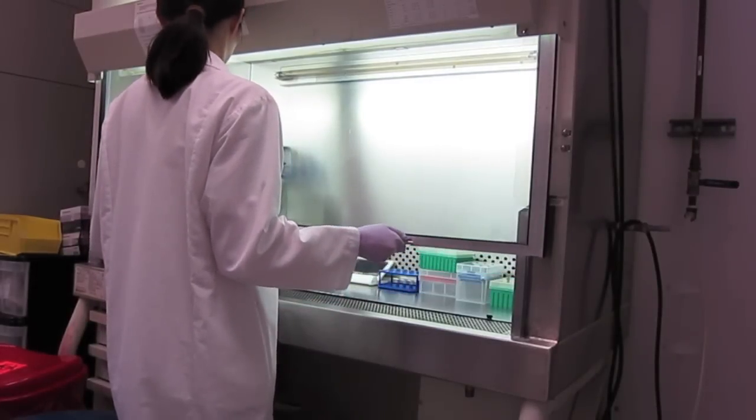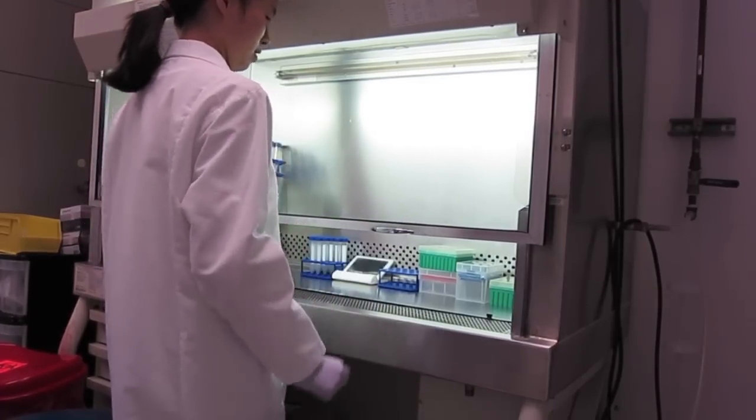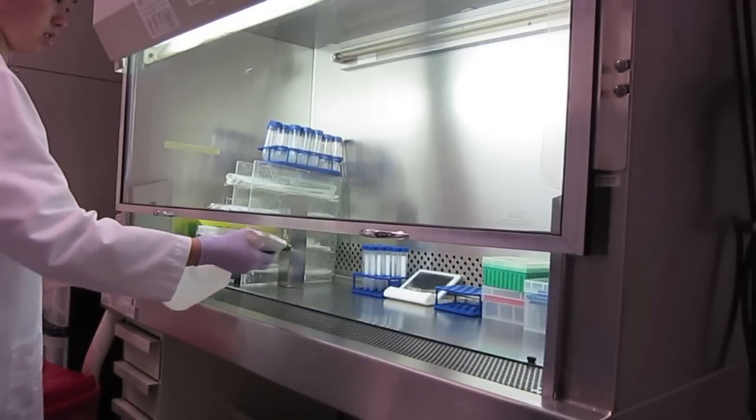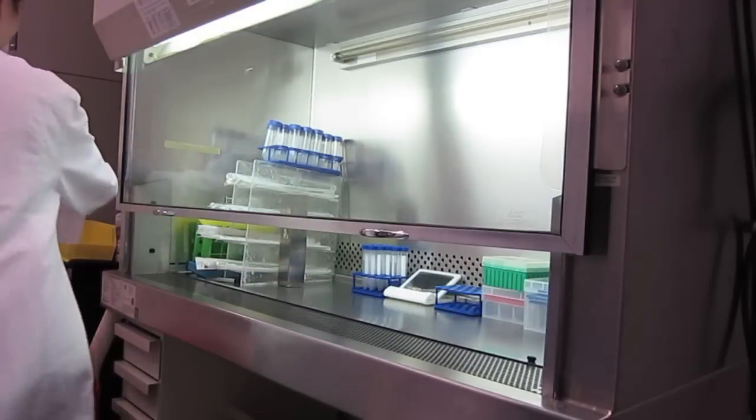After you have left the blower on for 30 minutes, you can start working. Before doing anything in the biosafety cabinet, wipe down all surfaces with 70% ethanol. Make sure to spray down the working area thoroughly.